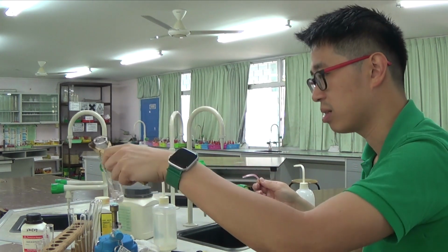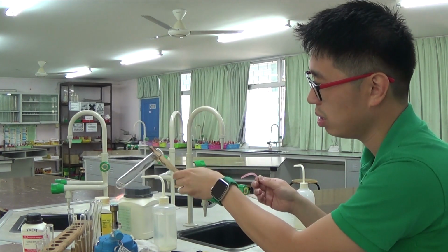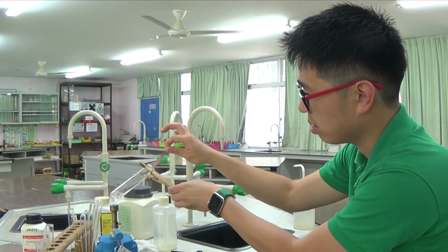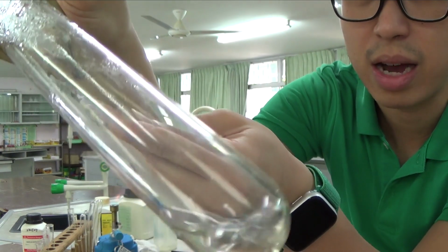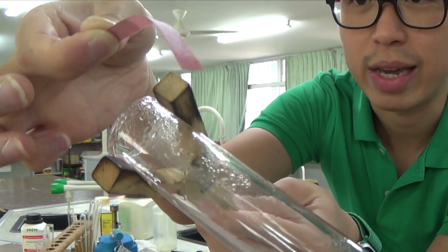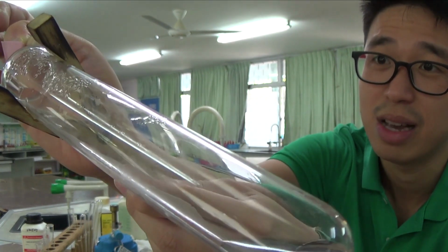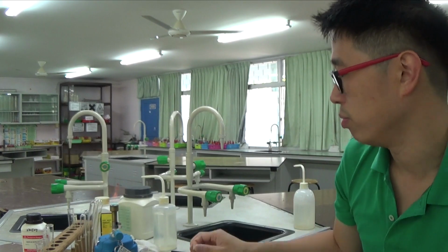So there's still a bit of gas being given out, but I'm not sure if that's just water or something. Okay, so I'll continue heating it, and then I'll test for the gas again. I hope you can see there's gas given out, but the red litmus paper is not turning blue anymore. So I guess there's just water. Water boils off at 100 degrees Celsius. You can see a bit of steam coming out, but the red litmus paper doesn't turn blue anymore.